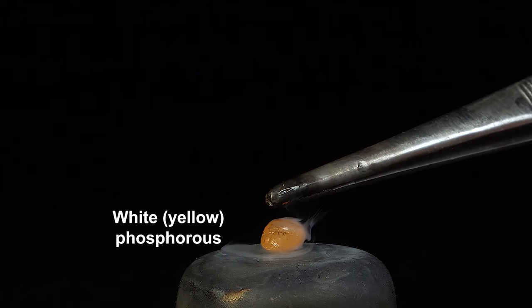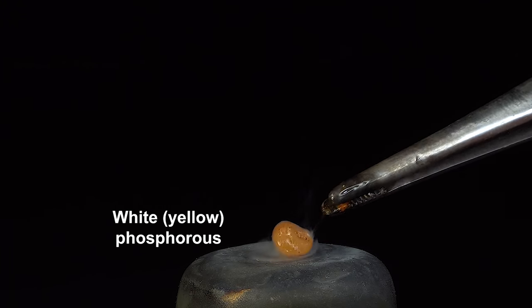If you leave a piece of white phosphorus in the open, it will melt and ignite rather quickly.